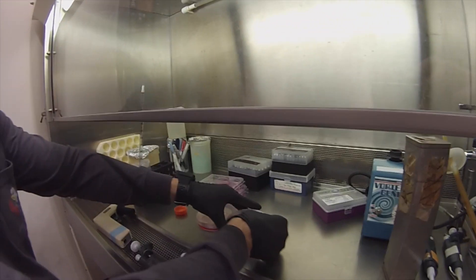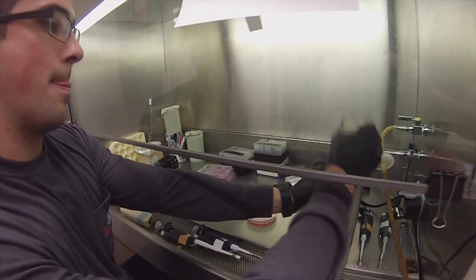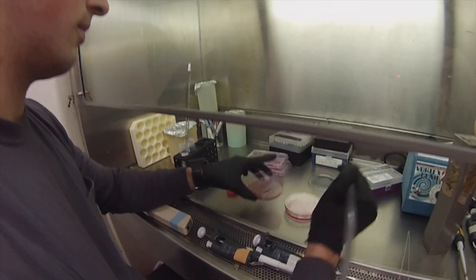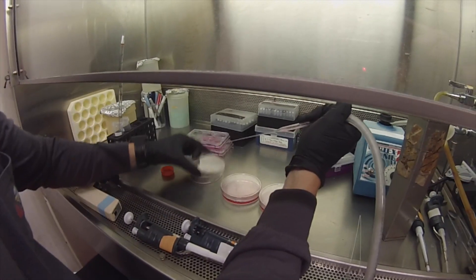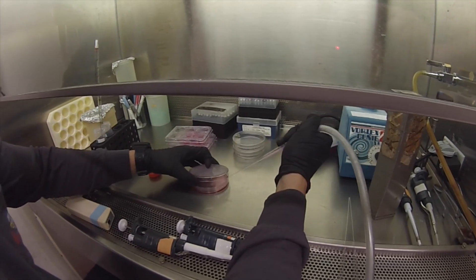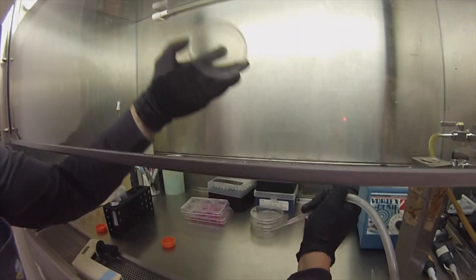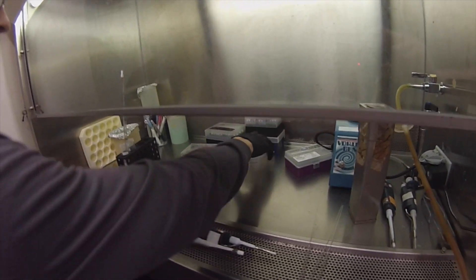After splitting those, we're going to go and do these. These three are ten mls each. Ten mls each.